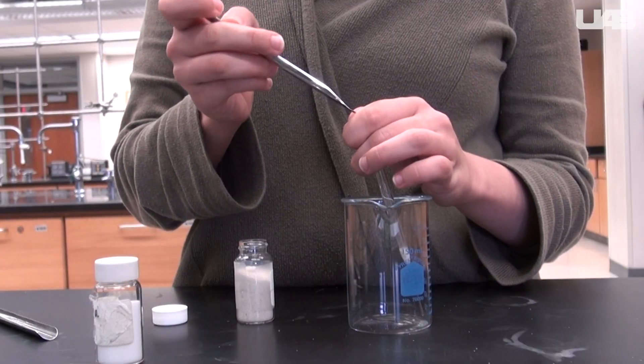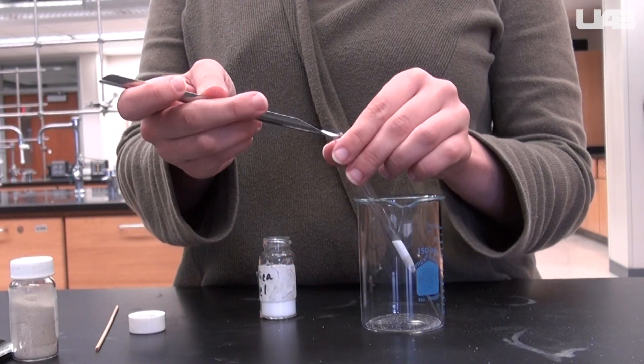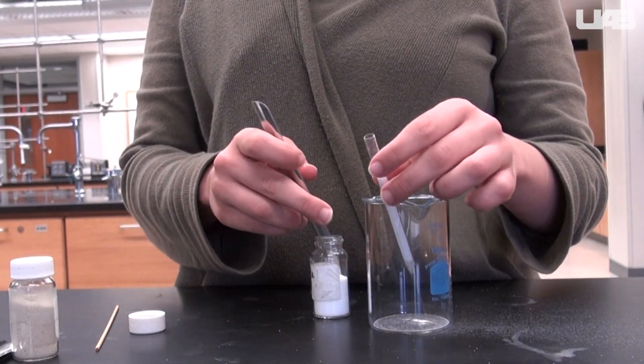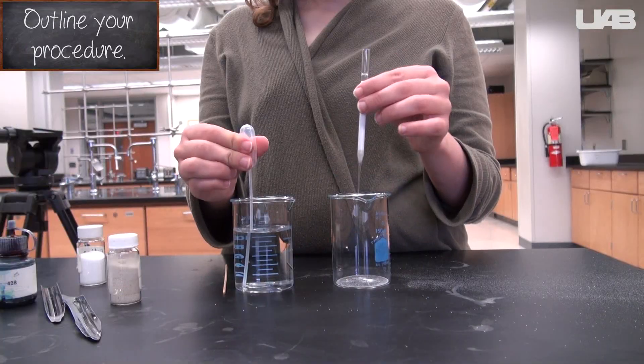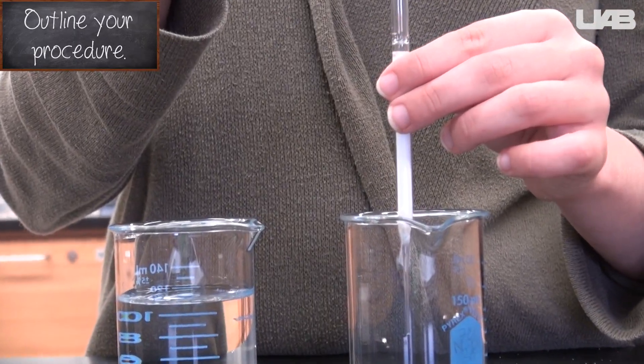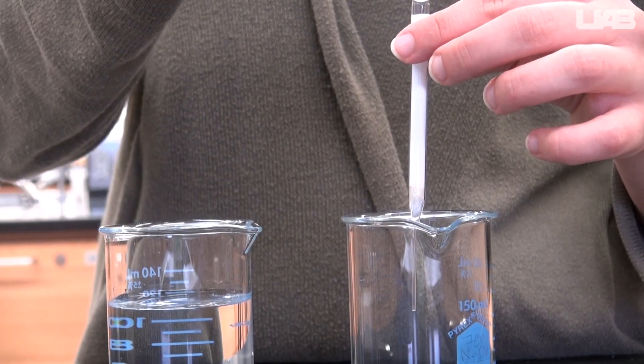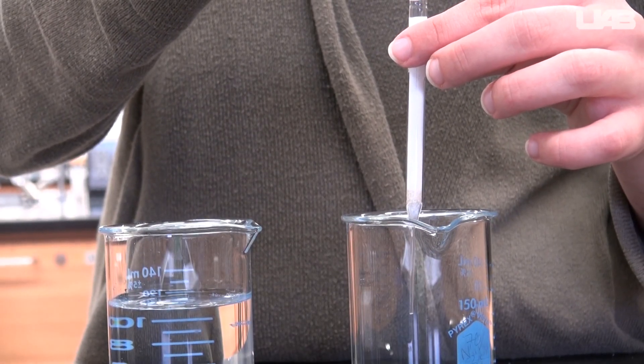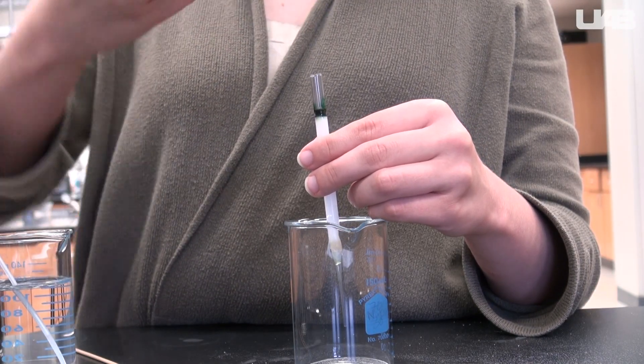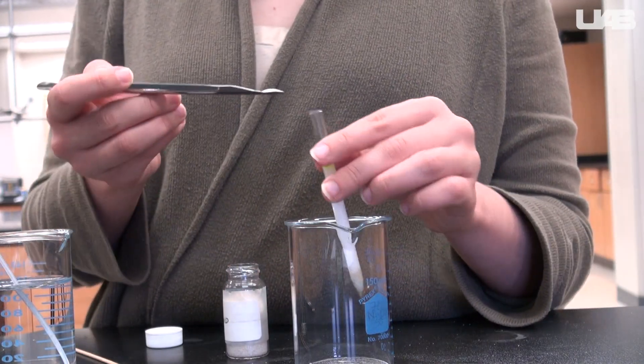Add a little bit of sand. Then add silica gel until it is about a half inch from the top of the pipette. All of the procedure up to this point can be done while waiting for your TLC plates to finish. There's that working in parallel. Take the solvent that gives the best separation and add enough of the solvent so that the entire column is wet and you can see the liquid is above the top of the silica gel. The solvent should not be allowed to go below the level of the silica gel during this exercise, but to put the unknown on the column, you should allow the meniscus to just touch the silica gel and then add two drops of your unknown.